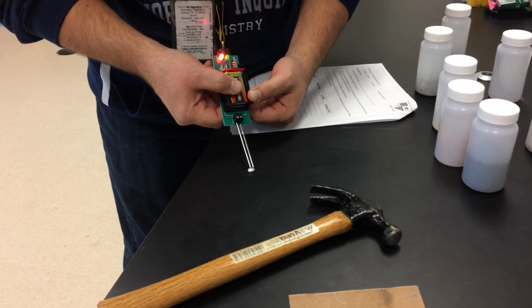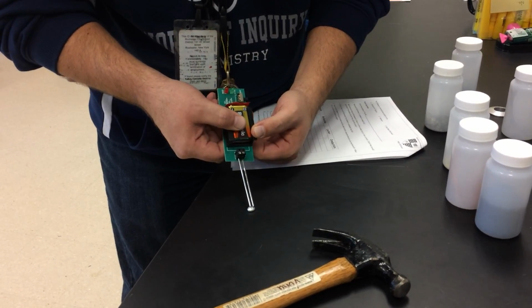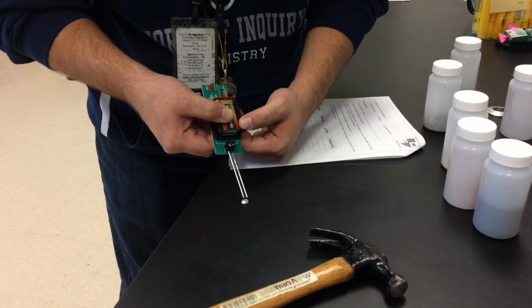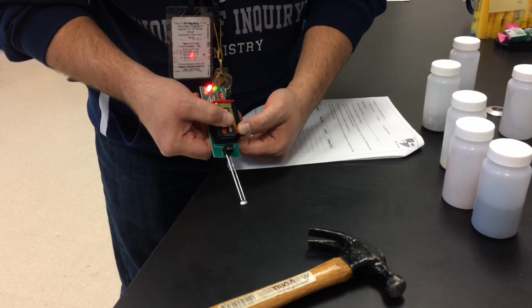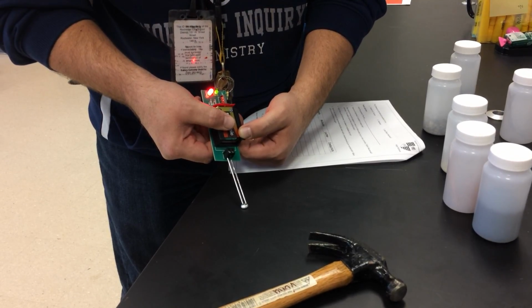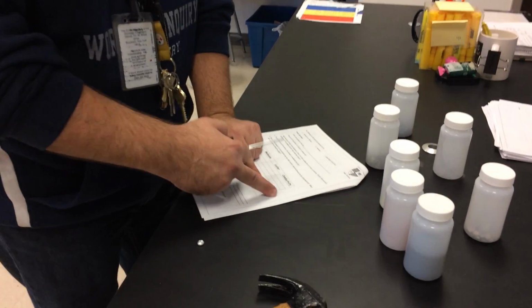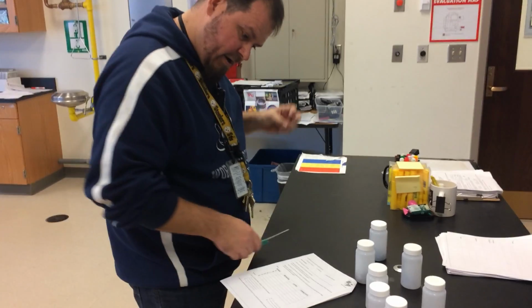Now notice, when I first did it, it didn't light up. And notice here, I'm touching it, it's not, but here it is. So these things are a little bit finicky, so you have to be very careful with this thing. I want you to take your time and give it a good college try to figure out if it lights up. So yes, it lights up. So for that sample conductivity, I'm going to say yes. Okay, and I'm not going to tell you what the sample letter is. You're going to figure that out on your own.